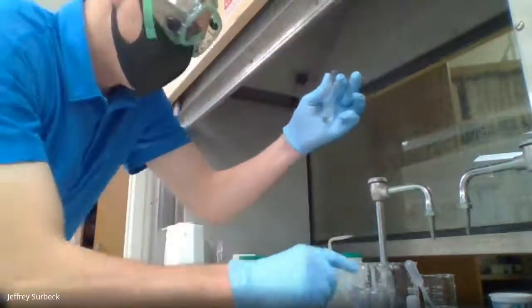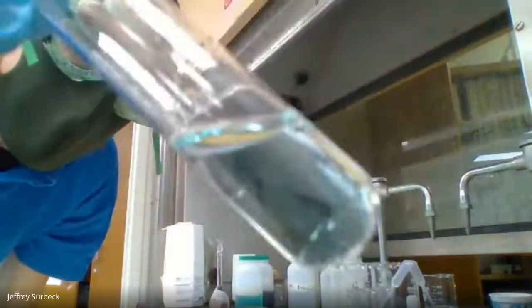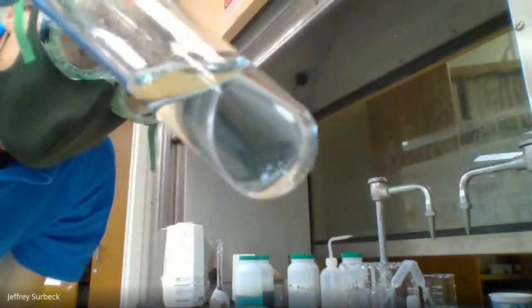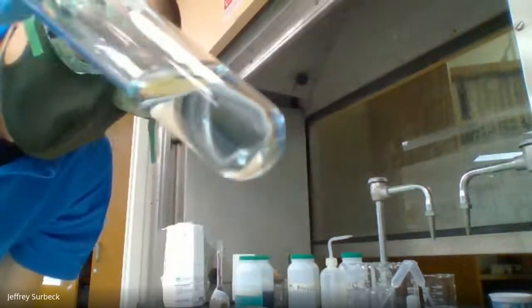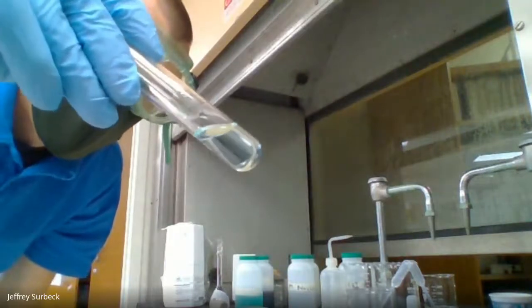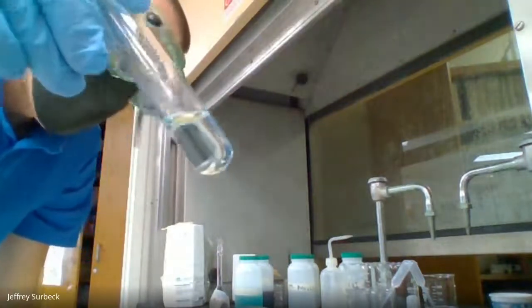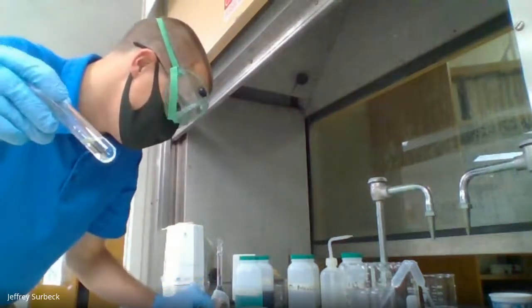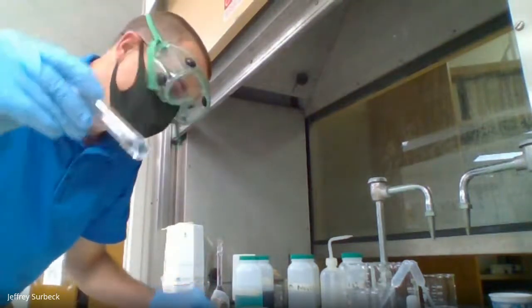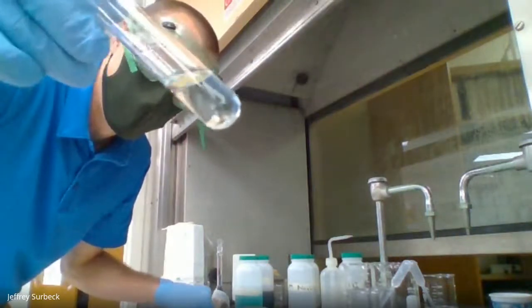Now you might not be able to see this, but I'm going to get as close as I can. This right here still has a little color. It's a light blue color. So I want you to record that under number 3. Again, there's very little color. You can kind of see the blue hue out towards the end here, but that is after we added our hydrochloric acid. So I want you to record this new color, the third color, under number 3 of the report sheet.